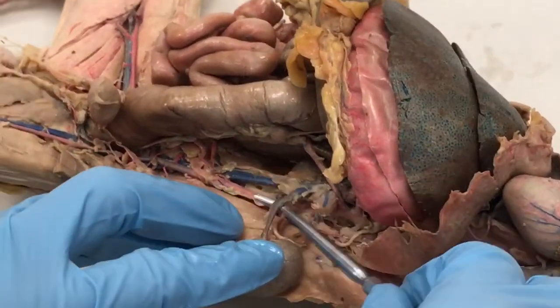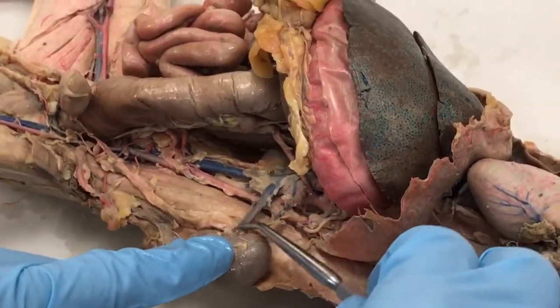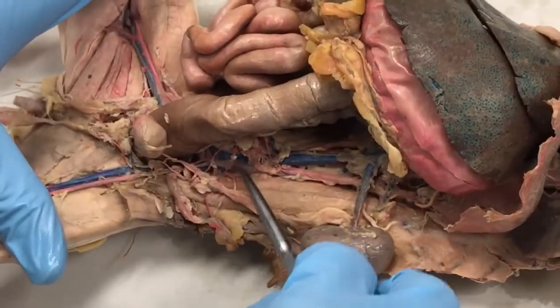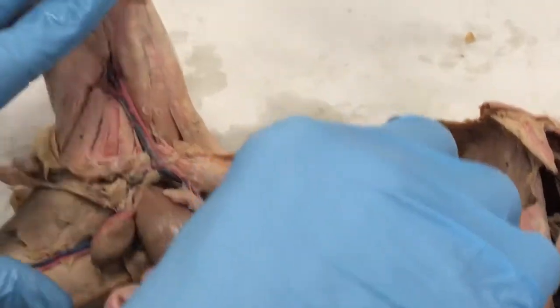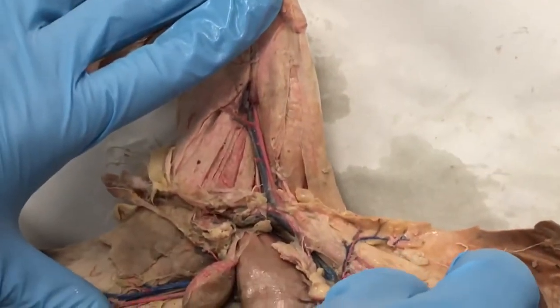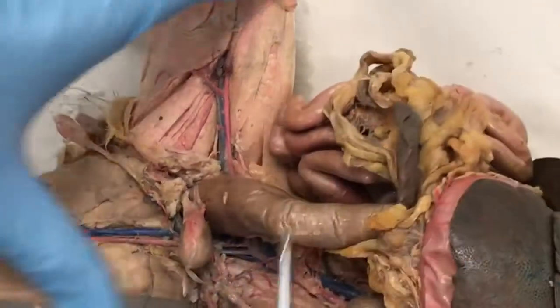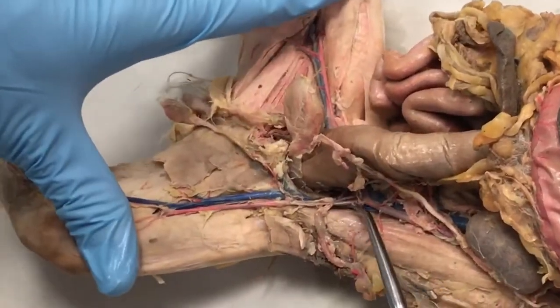The next vein we're going to see, in this case, is the left renal vein, and it services the kidney. And then we'll continue on down, and as before, we're going to come down to the Iliolumbar vein, which runs right parallel with the iliolumbar artery right here. That is the Iliolumbar vein. In this case, it's on the right-hand side. For whatever reason, it is not intact on the left-hand side on this particular cat.